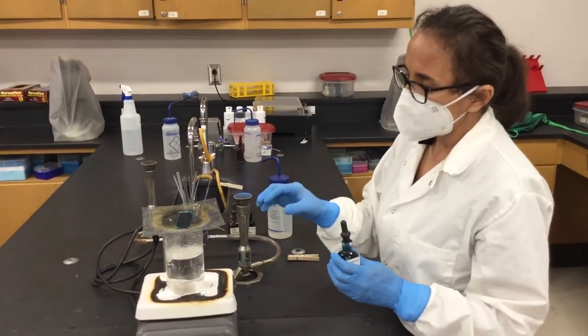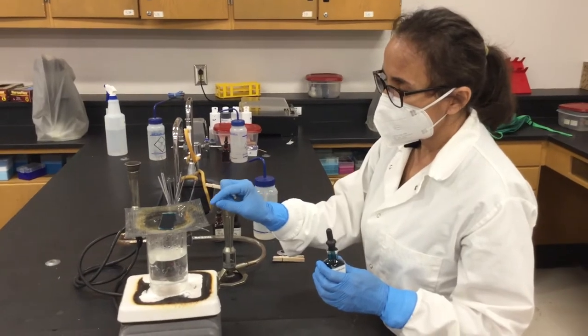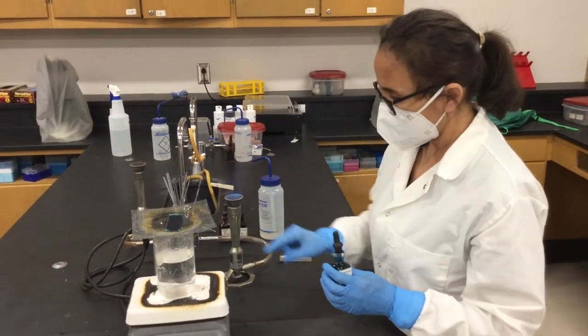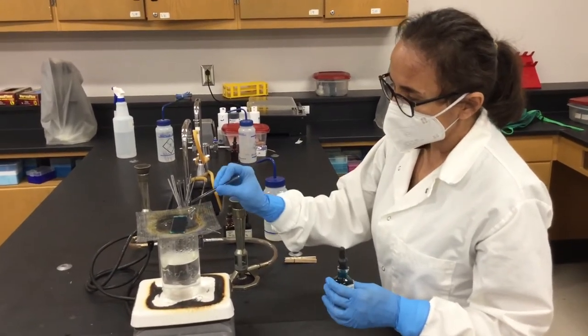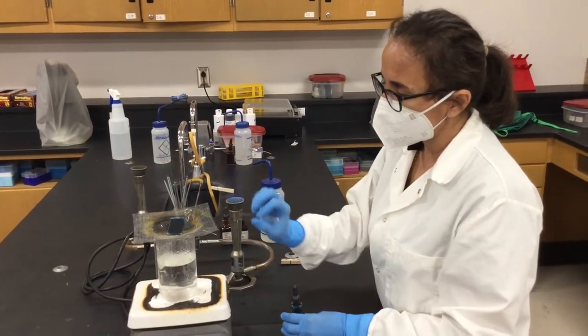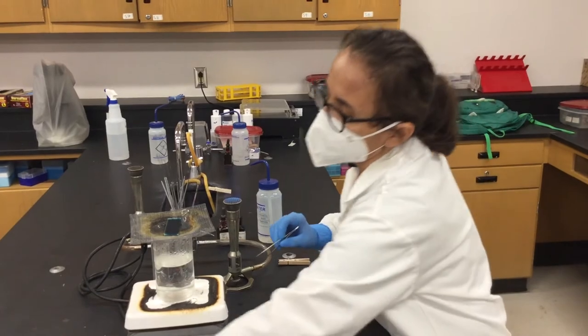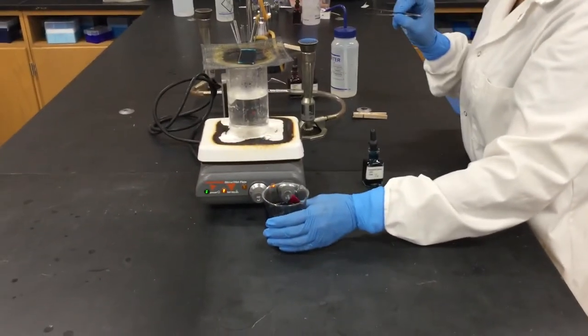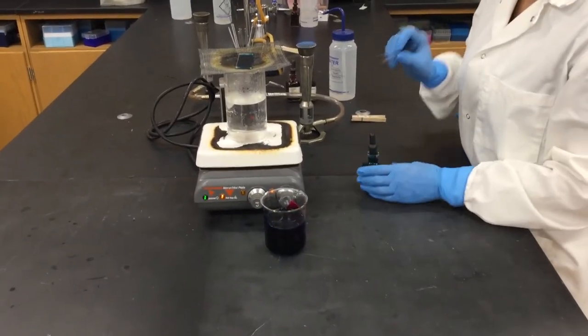And once you do that, you take away this paper from the top of your glass slide. It's for five minutes that you will be having it in here in this tray, and then you will put it in here, rinse, and add your safranin.